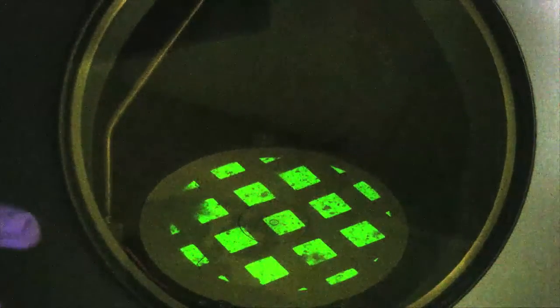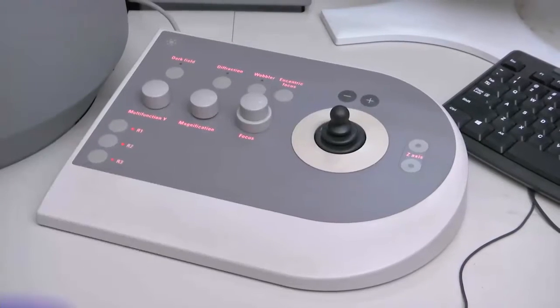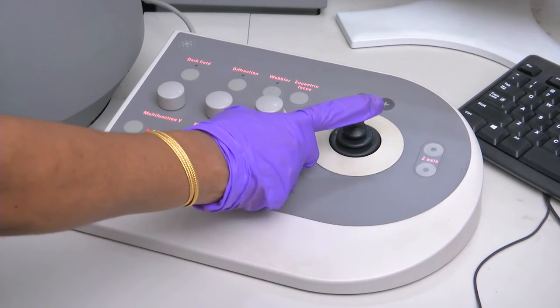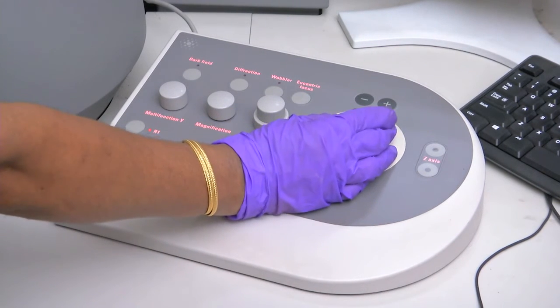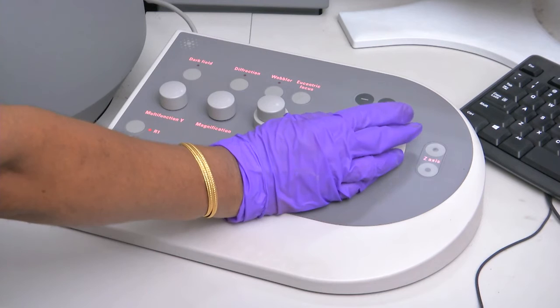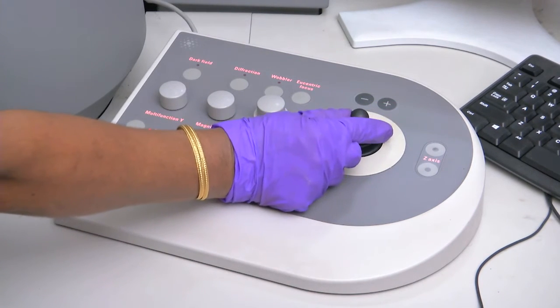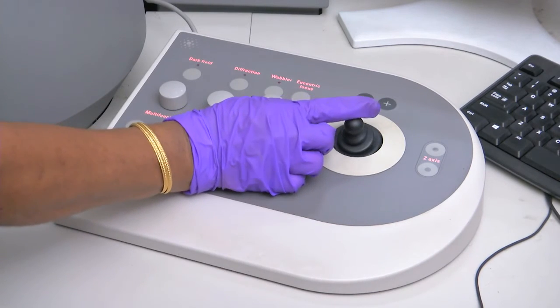This is the joystick — you can move the specimen in the x and y direction using the joystick to select the specimen area. By moving in x and y direction you can navigate in all directions.